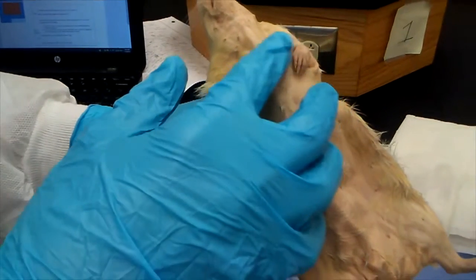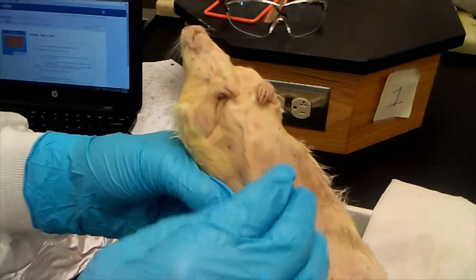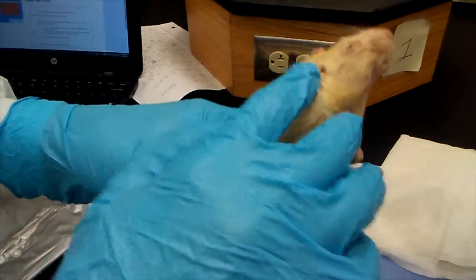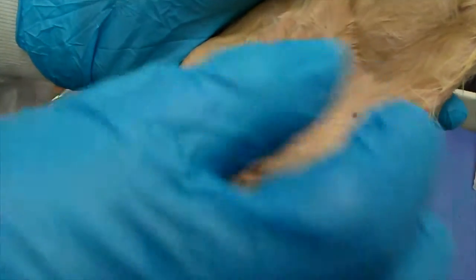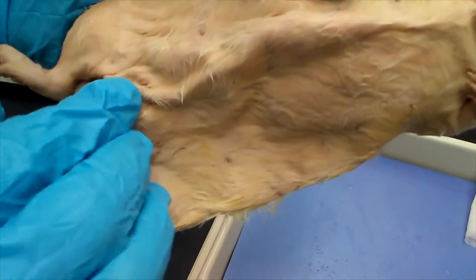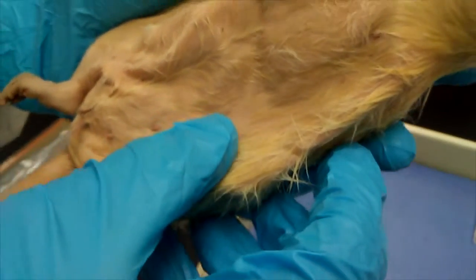Here is the thoracic area, which is mainly part of the chest. The pinnae are the ears, and since this is a female it's going to have mammary glands which produce milk for the babies — as you can see they're right here, they're very small. When it has babies, she will start feeding them using the mammary glands which make milk for her babies.